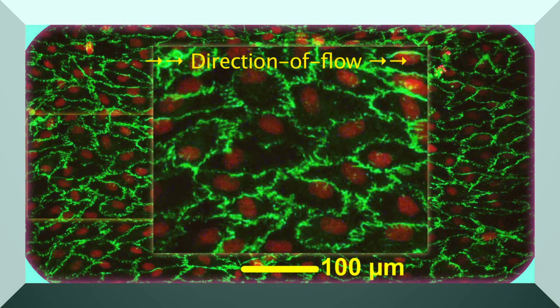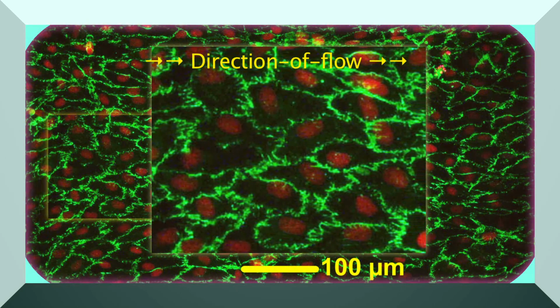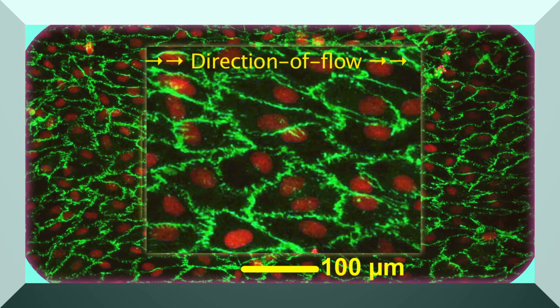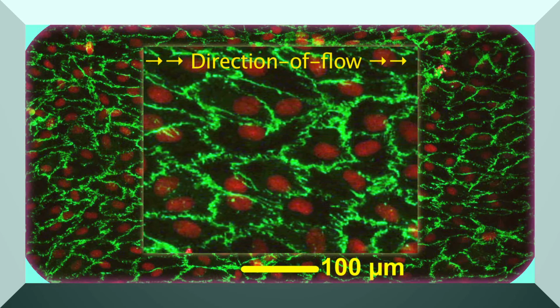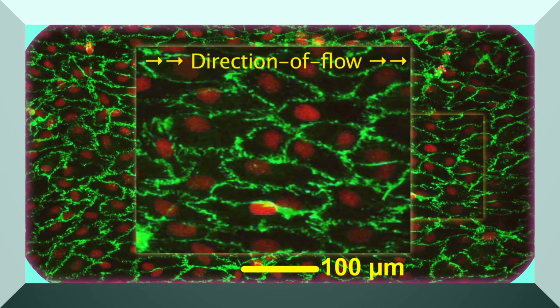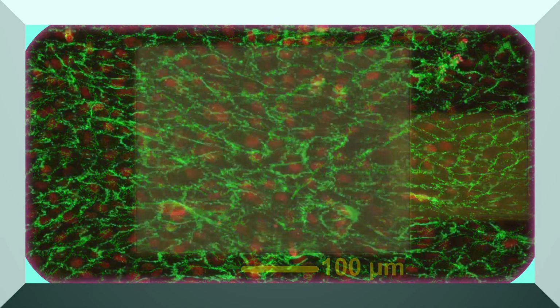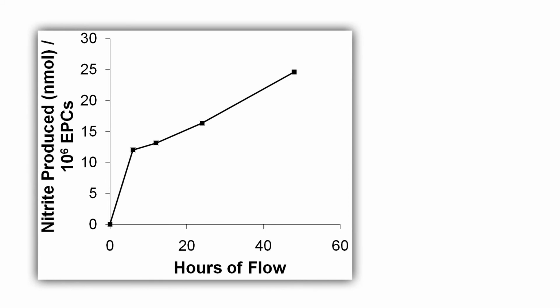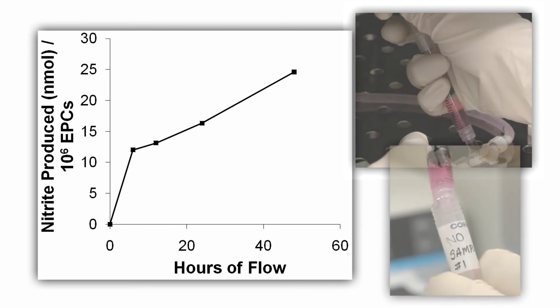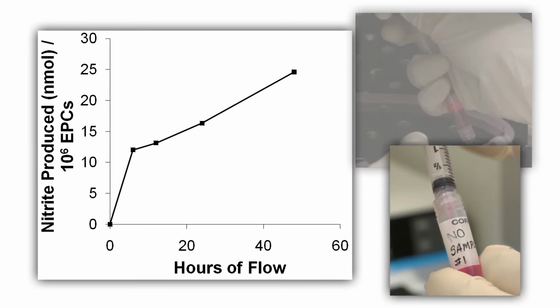For comparison, this image shows porcine EPCs on titanium slides in alignment with the direction of flow after 48 hours of flow and 15 dynes per square centimeter of shear stress exposure. Cell borders were stained with anti-PECAM stain and nuclei with Sytox orange nucleic acid stain. This method also allows for obtaining samples of the perfusate at predetermined time points for the analysis and/or quantification of secreted cell metabolites. Shown here is an example of the production of nitrite during a 48-hour flow experiment with porcine EPCs.